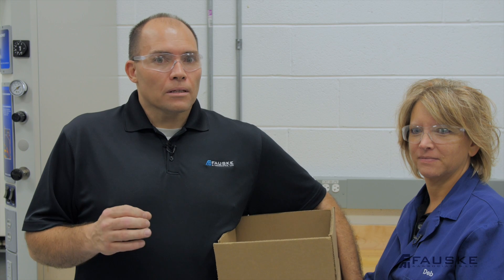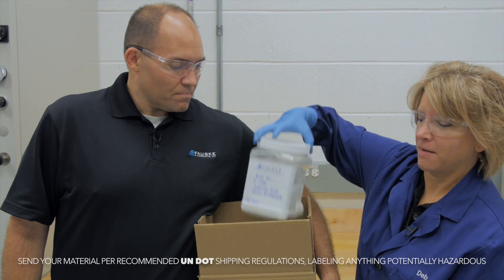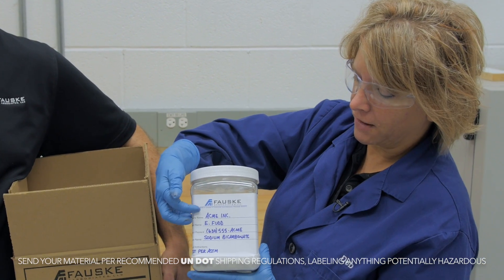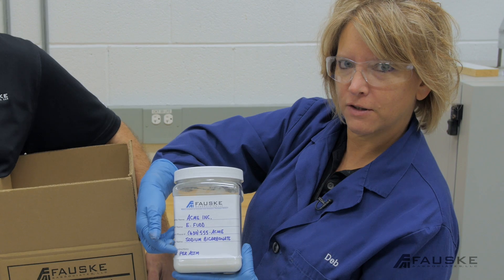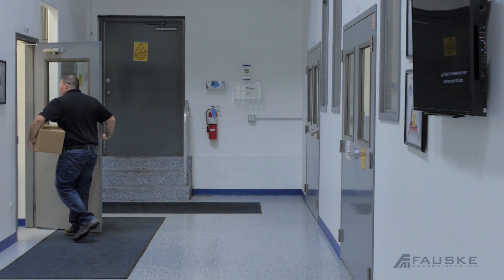Ideally, you want your sample to come in a container that is unbreakable and has a screw top lid with little chance for moisture to get into the sample. Here's an example of proper packaging for a sample: plastic bottle, secure screw-tight lid, clearly labeled with the name of the company, the contact, the sample name, and any special instructions that the client might have. Now we can make our way into the prep lab and get our sample ready for testing per the instructions of the customer.